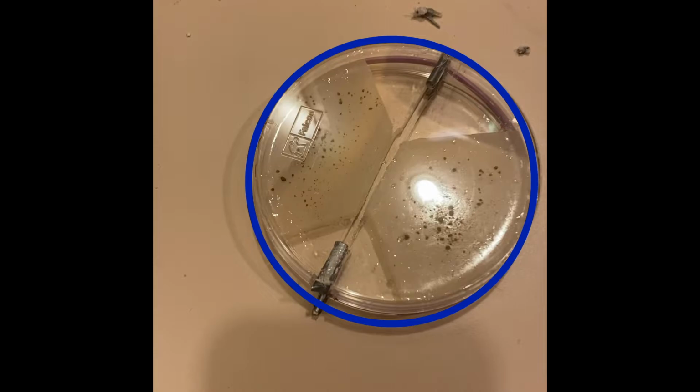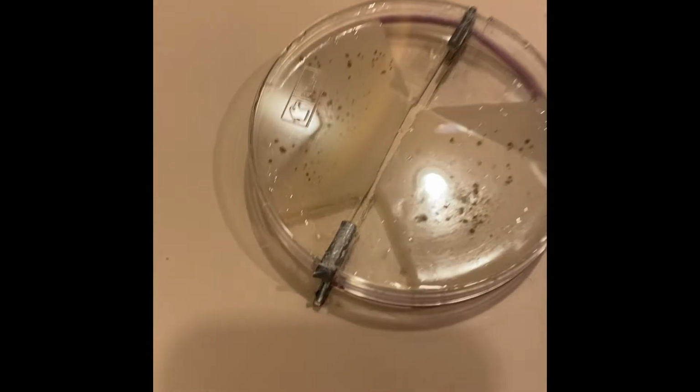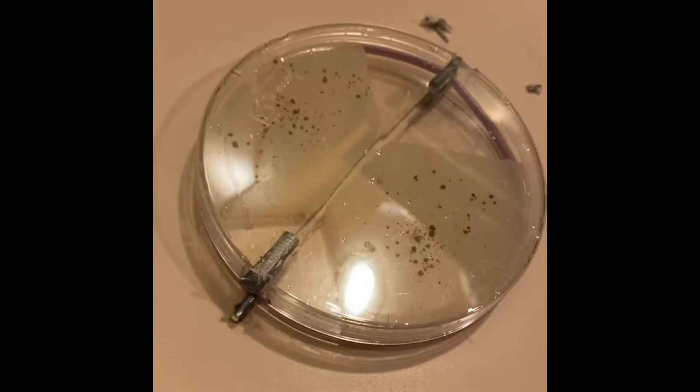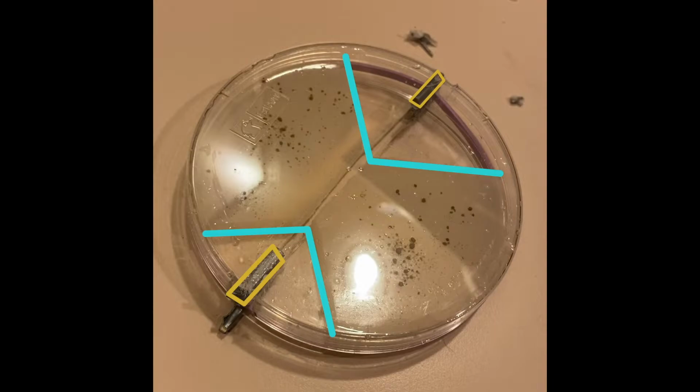We know the rubber band is a very poor conductor, but what about the wooden shims? Could these conduct a signal? Well, we have tested the setup described as is, but with no mycelium inoculated, and we could not get an electric signal to travel from one island of agar to another. This makes sense. The agar islands are electrically isolated from one another, and the shims are in no way touching the agar. This helps support the idea that our data is not the result of signals traveling across the wooden shims.